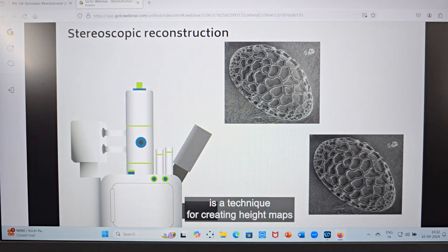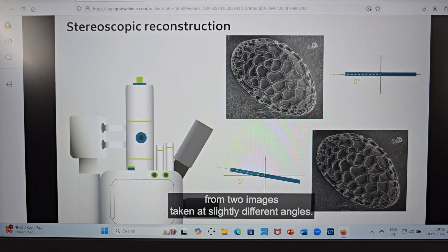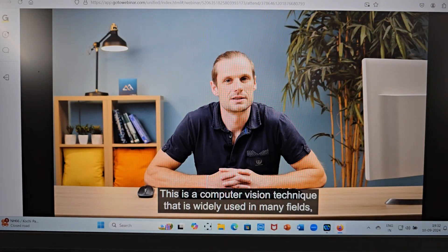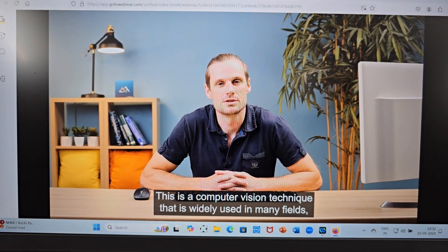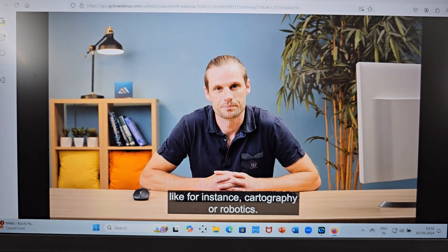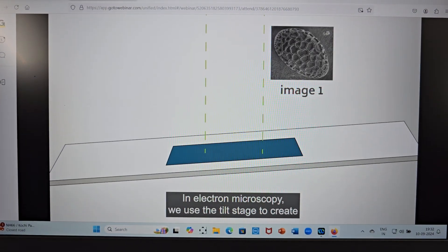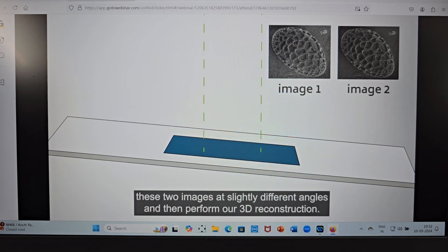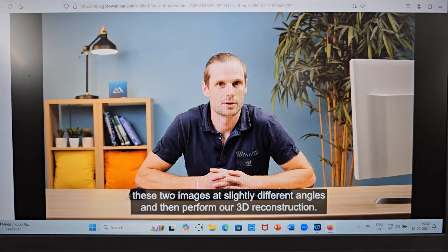Stereoscopic reconstruction is a technique to create a height map from two images taken at slightly different angles. This is a computer vision technique that is widely used in many fields, like cartography or robotics. In electron microscopy, we use the tilt stage to create these two images at slightly different angles and then perform our 3D reconstruction.